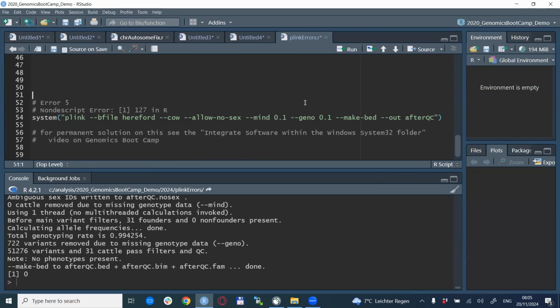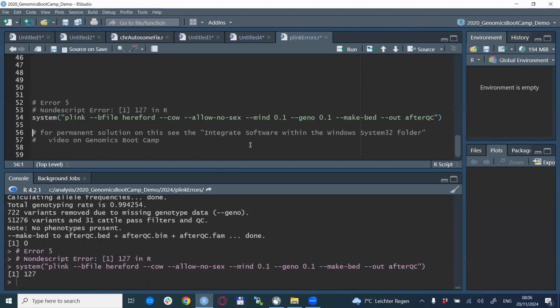And the last error type I want to talk about today is the most tricky one. This is actually just a number, so it's very hard to figure out what's happening. It just says 127, and that's what you get. Here, this is the normal looking PLINK line. We have the B file, the cow, everything with a small quality control and then some output, but when we run this, actually this error just says 127, and it's hard to figure out what's happening.